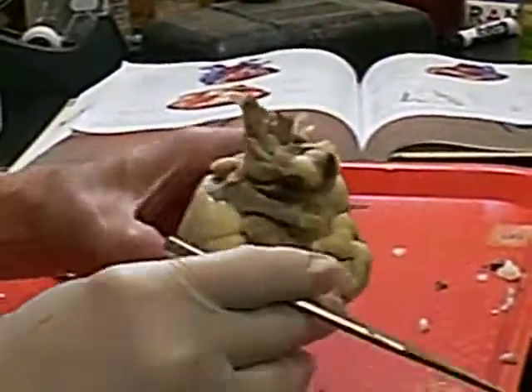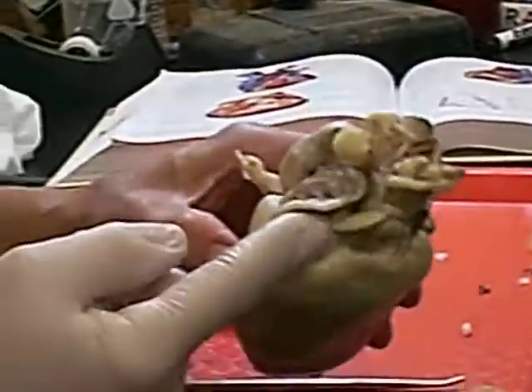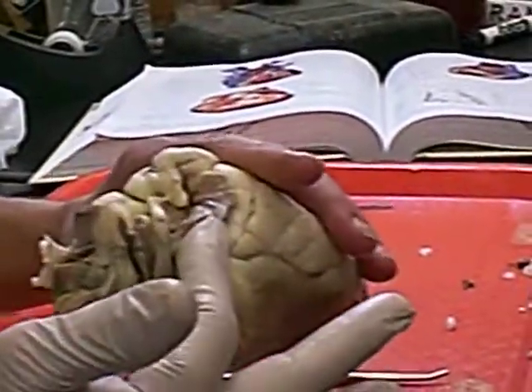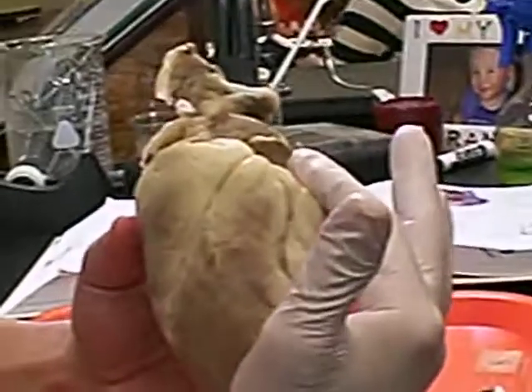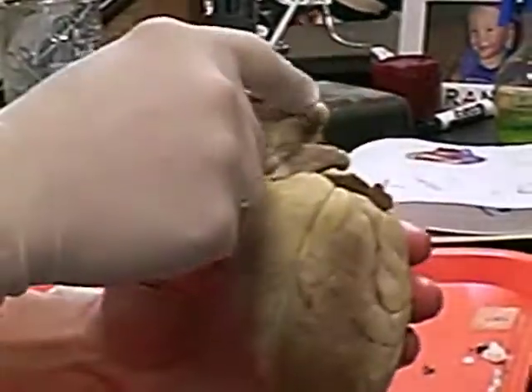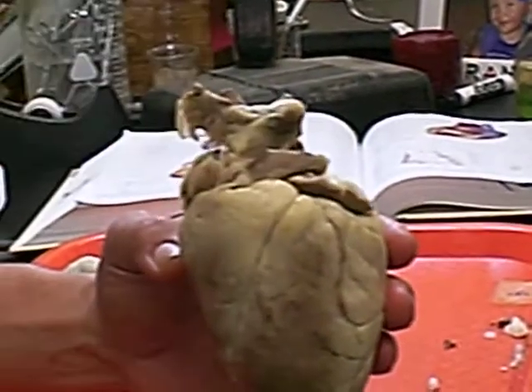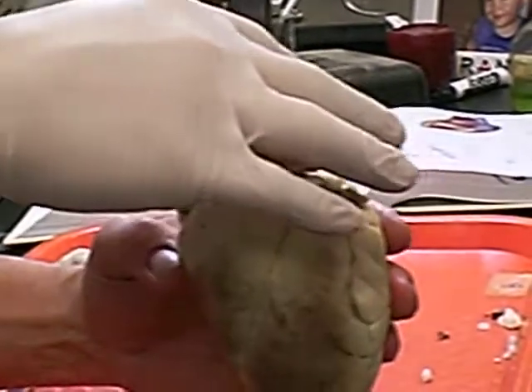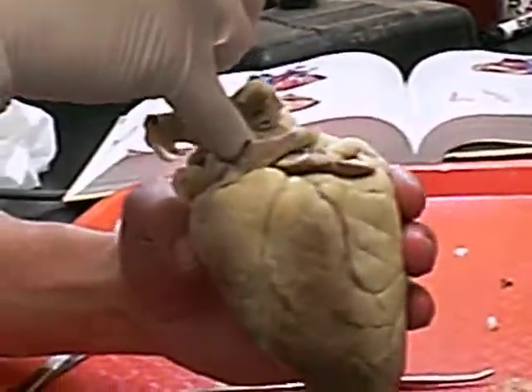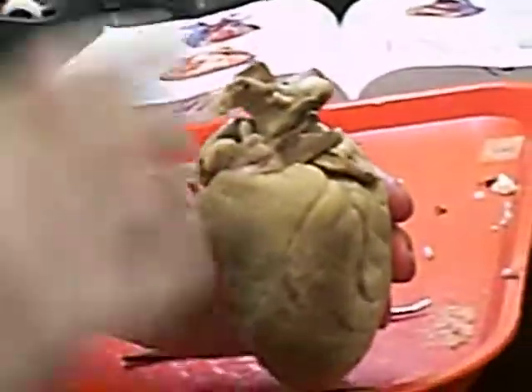If we look to the top, on this side is the right atrium, left atrium. The vessel furthest forward on the top, in the front, is the pulmonary trunk. Next behind that is the aorta.